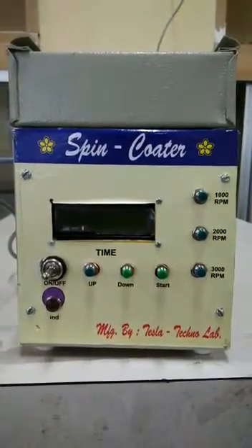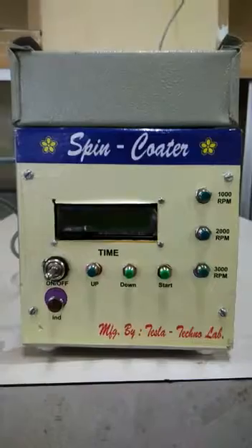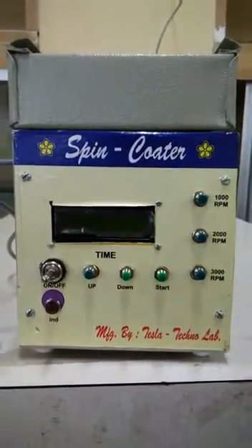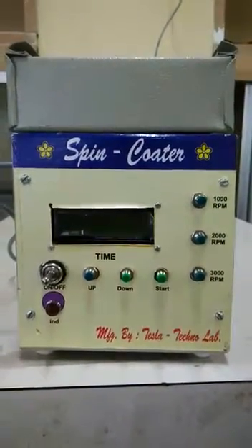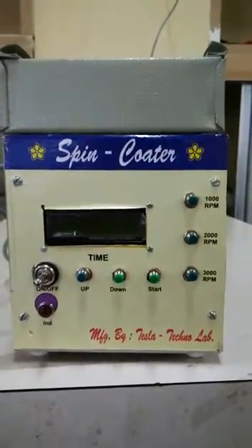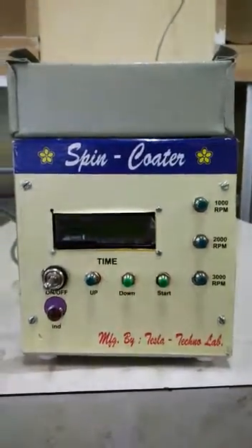Good morning friends. My name is Yogesh. I have designed a small spin coater for research lab equipment. This spin coater is a two-stage spin coater with fixed RPM.